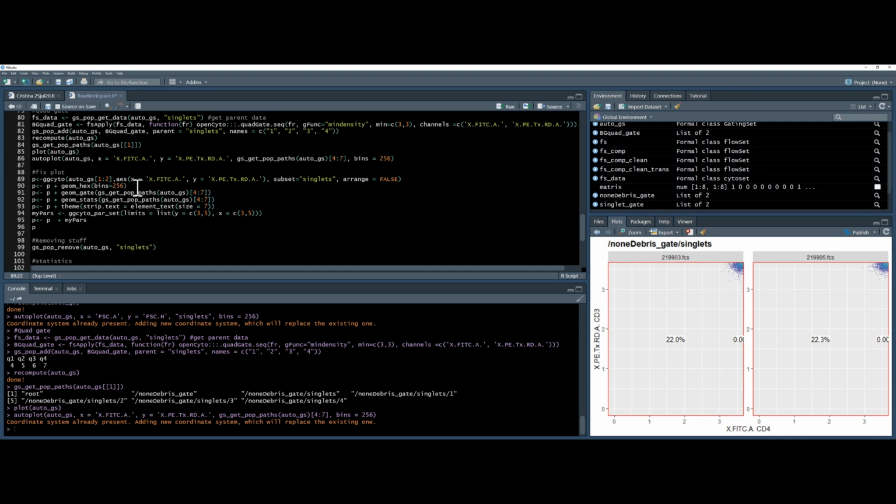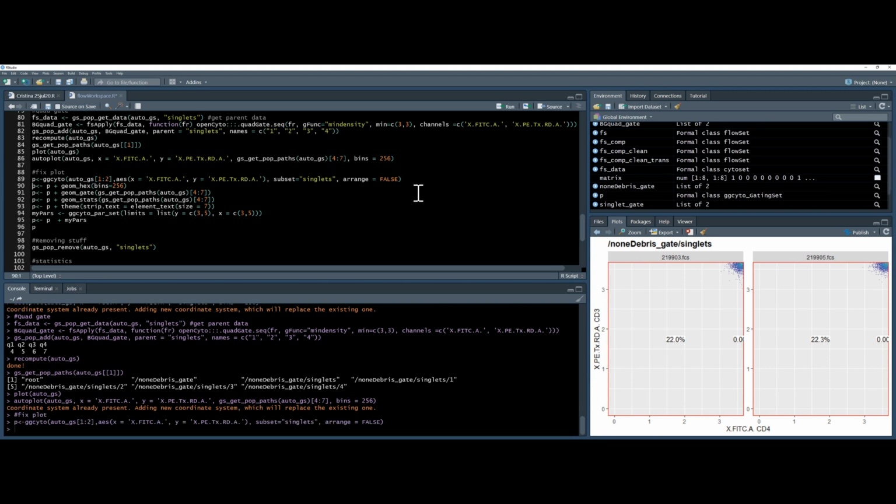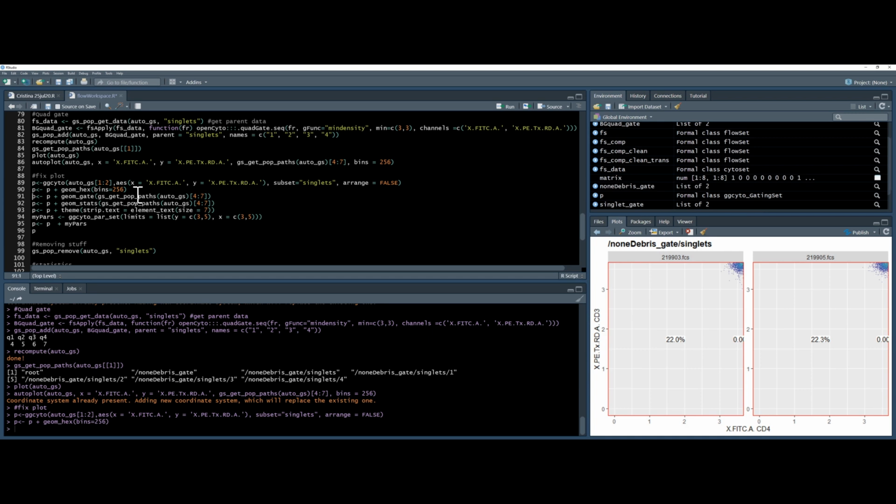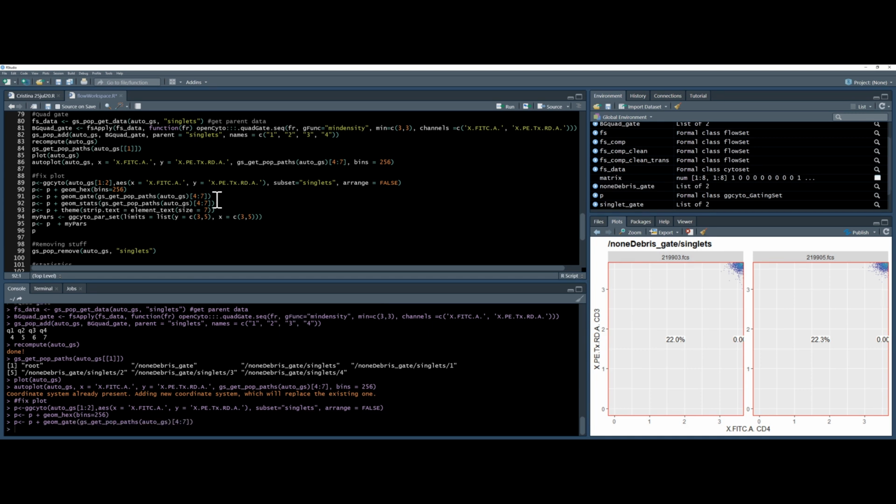AES stands for aesthetics, and there's some X and Y parameters. My subsets are singlets. This creates a variable called P, which has my gate in it. I want to use 256 bins, so that's my density. I want to add gates 4 to 7. I want to add the statistics 4 to 7.